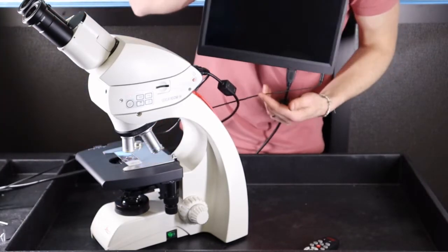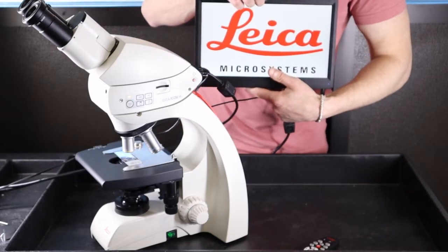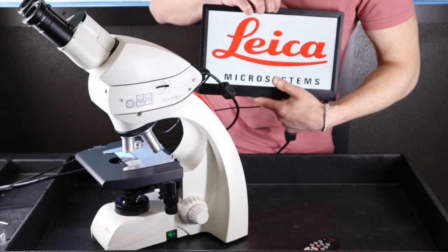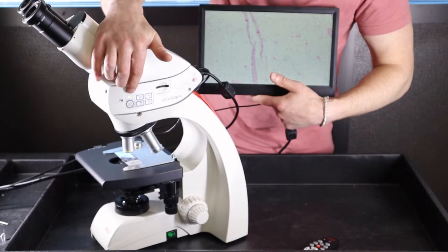I have a little screen here for ease of demonstration. As the camera boots up, it will start with this green light becoming solid.